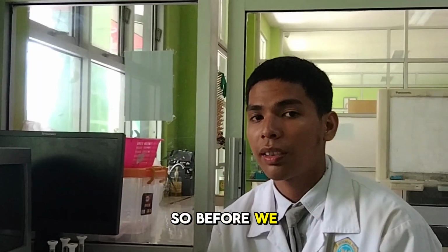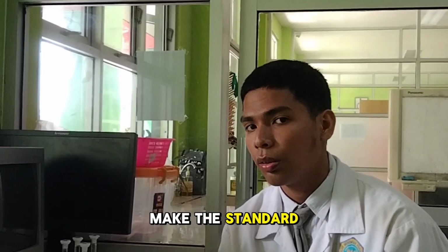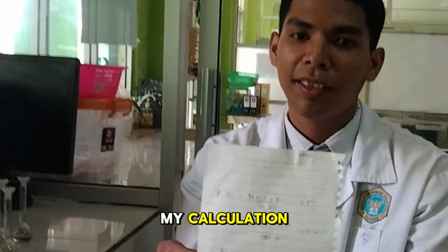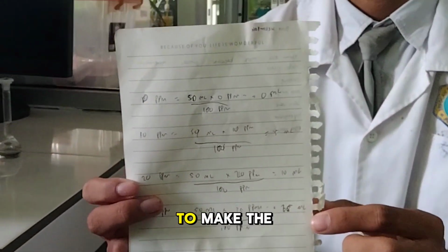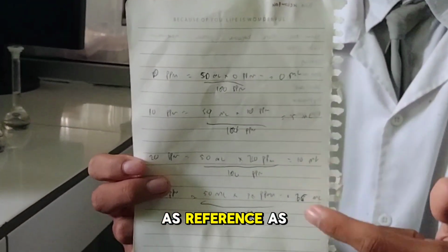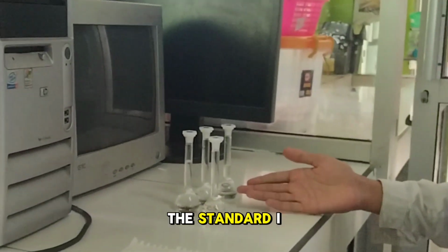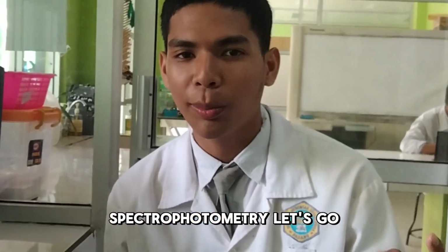Before we start the analysis, we need to make the standard using a calculation, and this is my calculation. We make the standard using this calculation as reference. This is the standard I made. So let's start to use the atomic absorption spectrophotometry. Let's go.